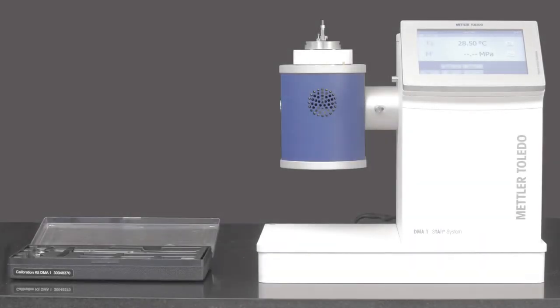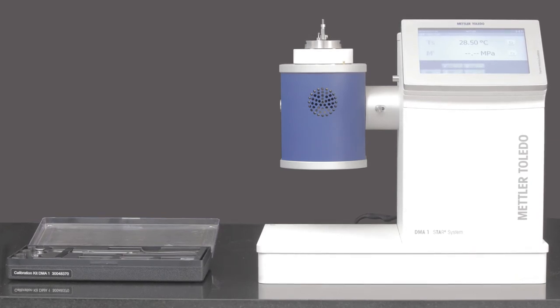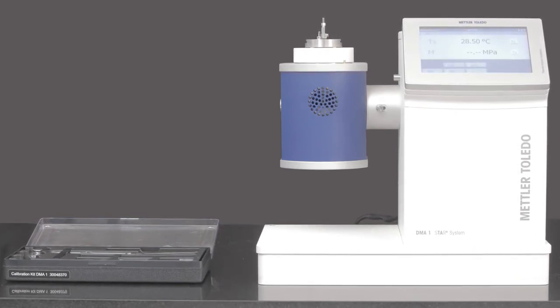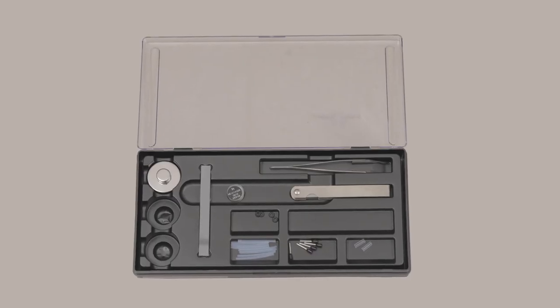We will now show you how to perform a force calibration and adjustment on DMA1. You will need the following accessories: the calibration tool box.